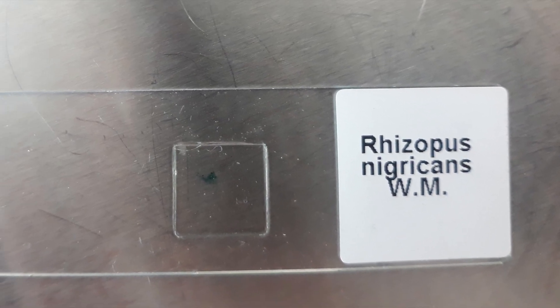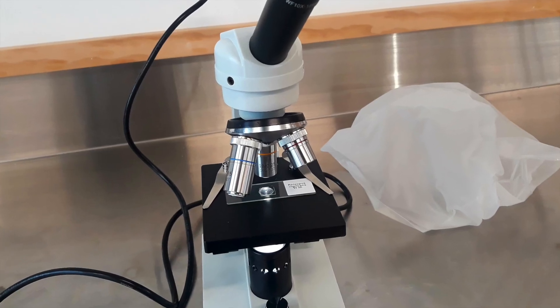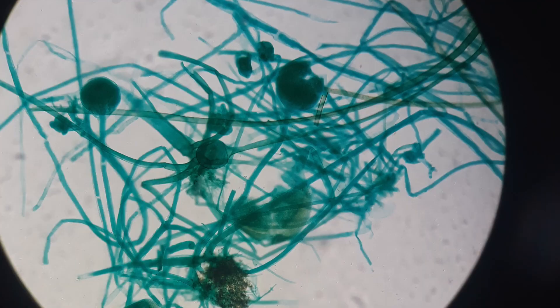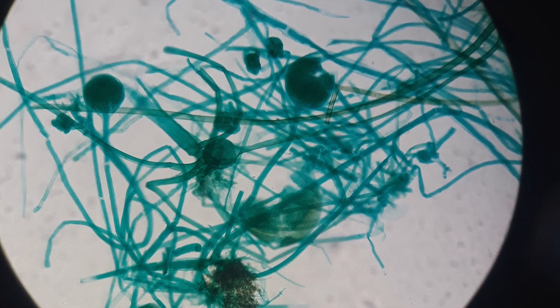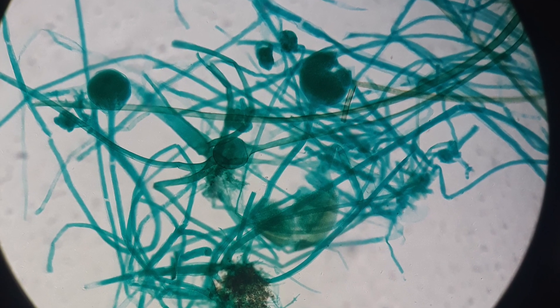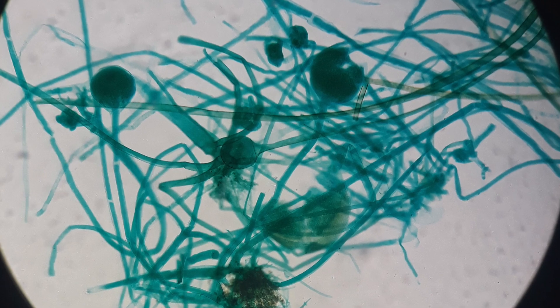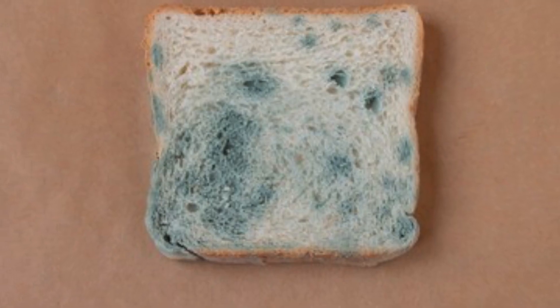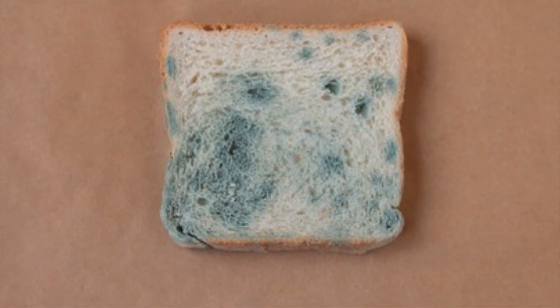Let's put our slide under the microscope. Rhizopus is a fungi commonly found on spoiled fruit and bread, which is also why we called it bread mold at the start of the video.